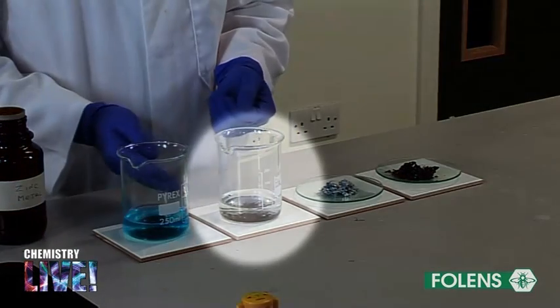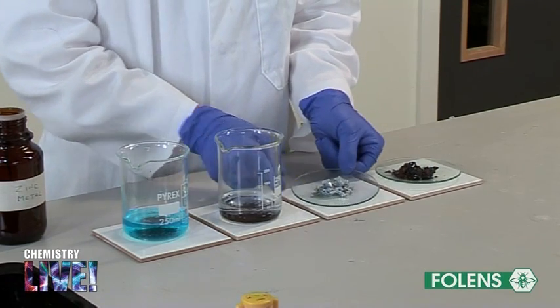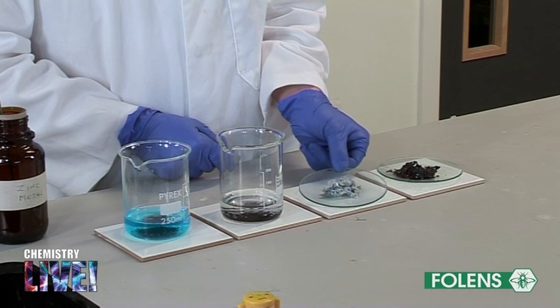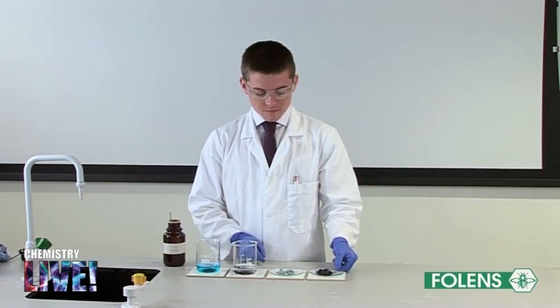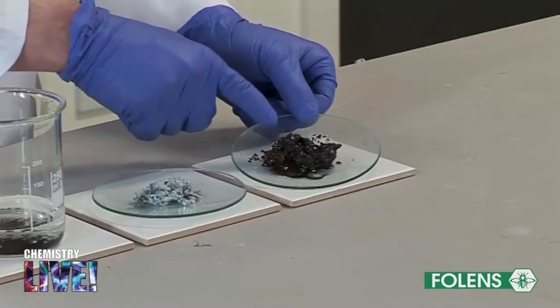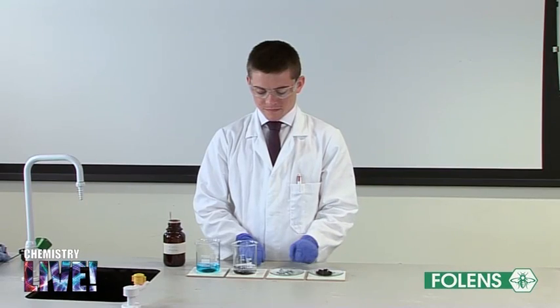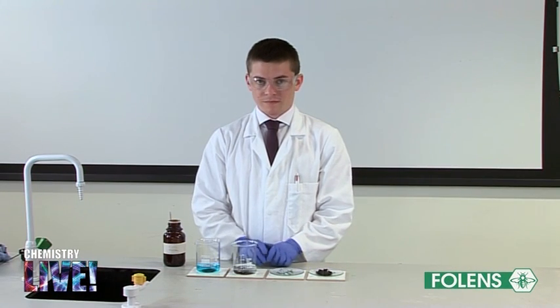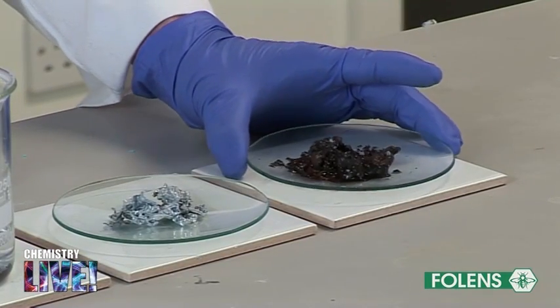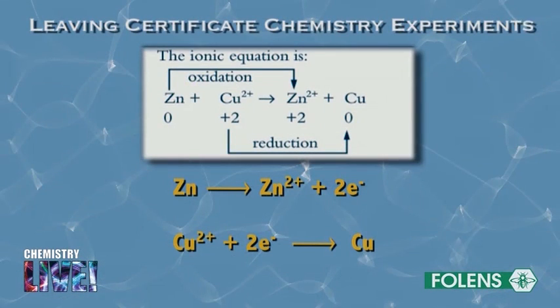This experiment may also be carried out by adding some granulated zinc, shown on a clock glass, to some copper sulfate solution. After about 1 hour, note that the pieces of zinc have been covered with copper metal. This is because zinc has a greater tendency than copper to lose electrons, and the zinc forces the Cu2+ ions to accept electrons, as shown by the equation on the screen.